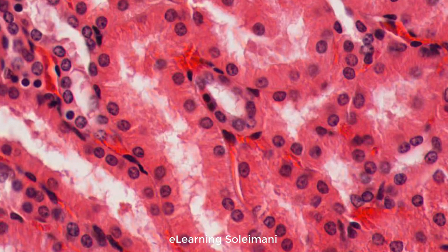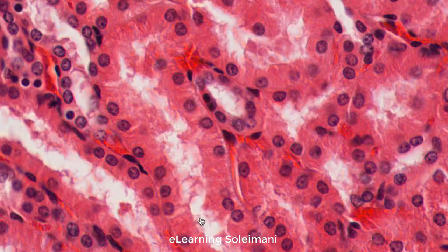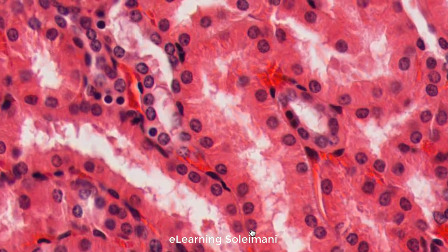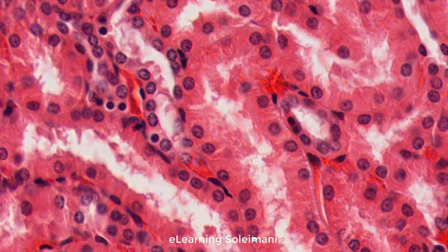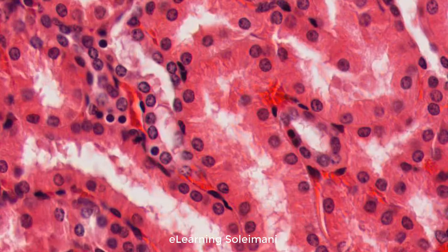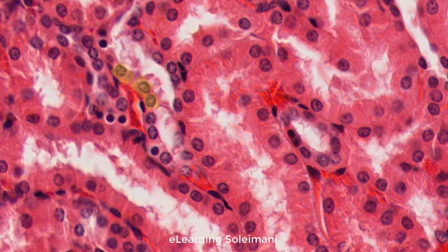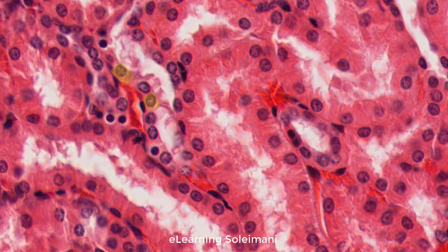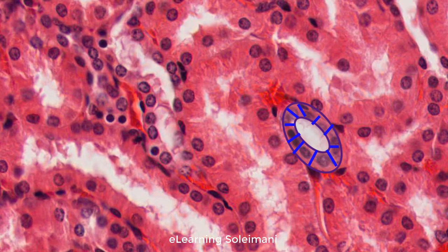Parts of both the distal and proximal convoluted tubules are visible here. Distal convoluted tubules contain simple cuboidal epithelium. These cells have almost equal length, width, and height, with a round nucleus.